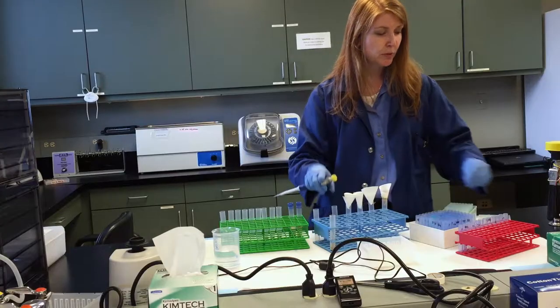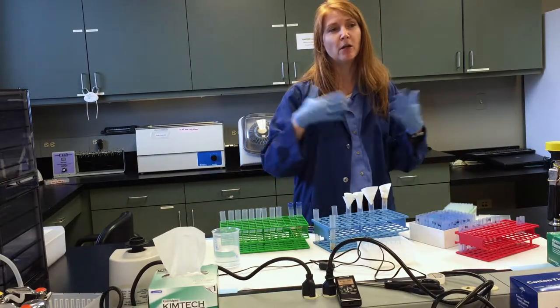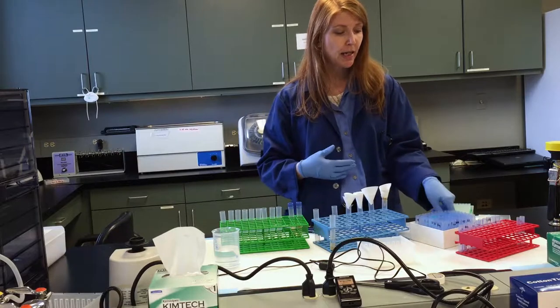And then these test tubes, we have literally just allowed to air dry. What this is, the alcohol is going to air dry, and then eventually what we'll be shipping is a box like this of a hundred samples with no liquid in it.